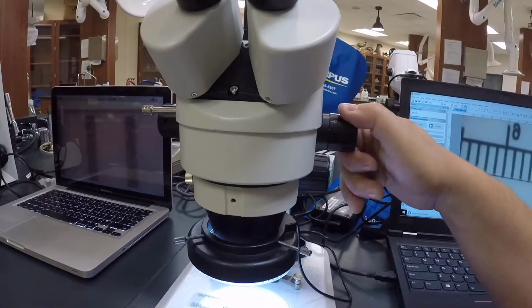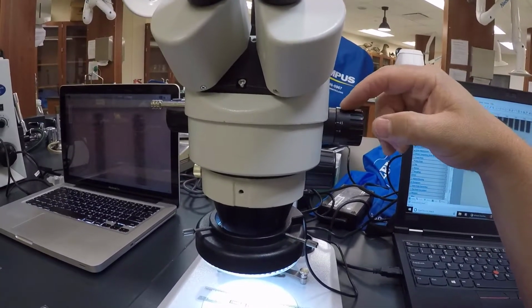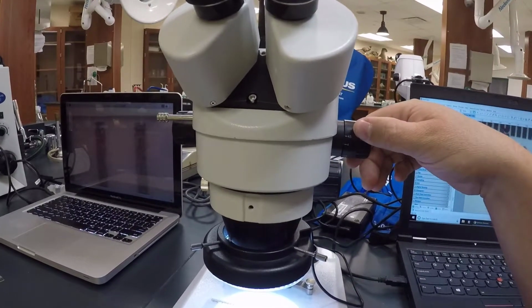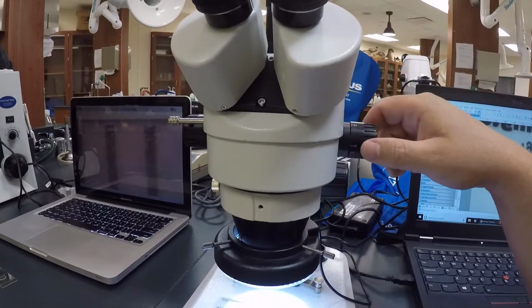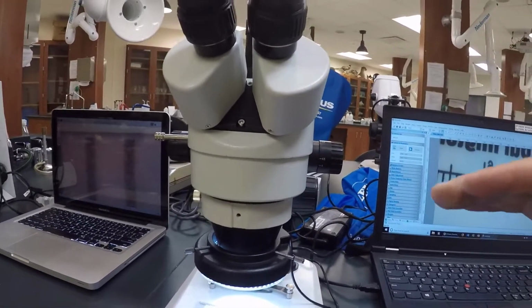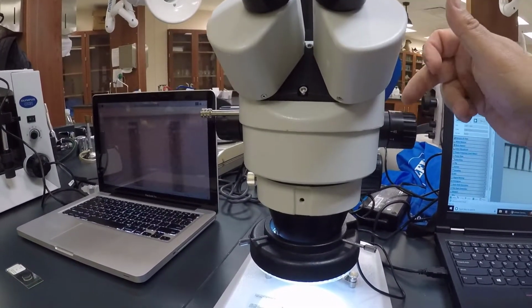So we can start all the way down here at 0.7, times 10, so this is 7 times your eyesight. But the next one is 0.8, or 8 times your eyesight. So if I go halfway in between the two, it's still a magnification. So now this would be 7.5 times your eyesight.